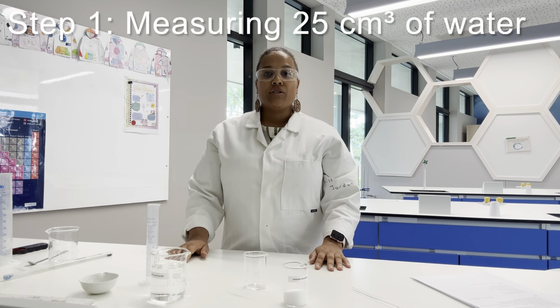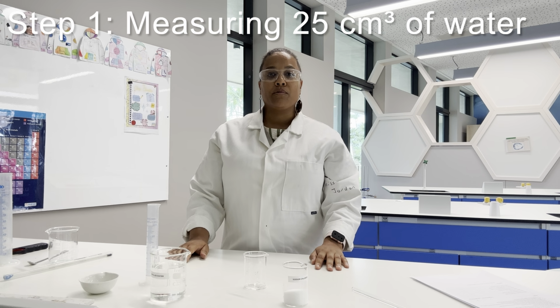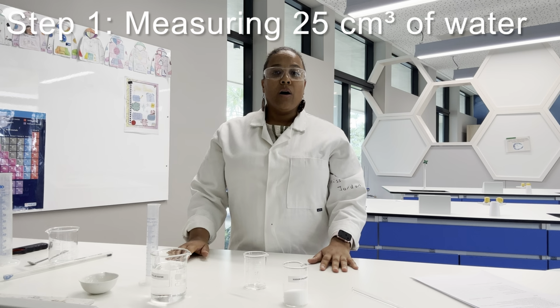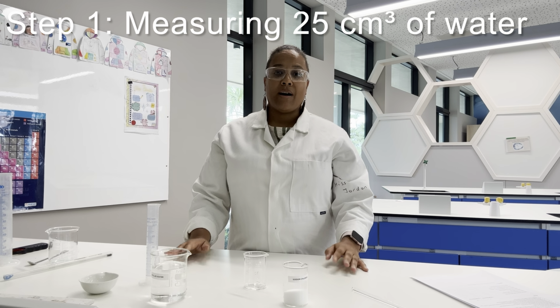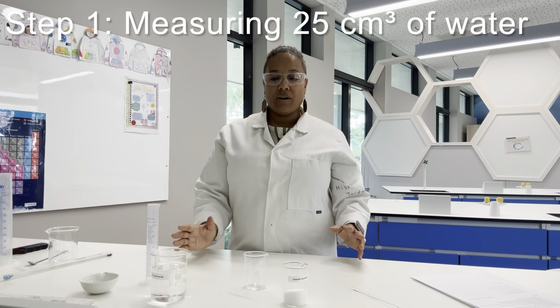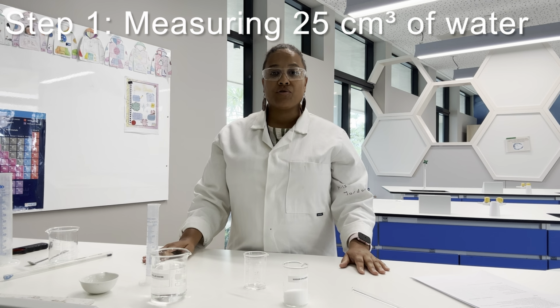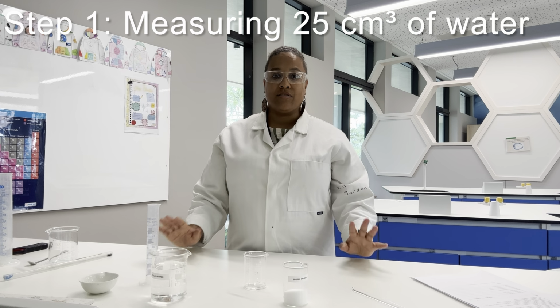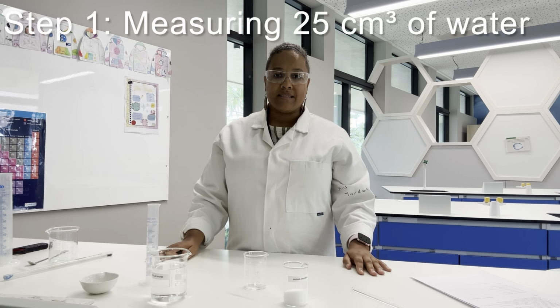So I'm going to use 25 centimetre cubed of water today, and that is because we can scale that up by 4 to work out how many grams dissolves in 100 grams. If I put 100 grams of water in, that would mean that I would have quite a lot to evaporate off at the end. So we'll come to why that is a bit later today.